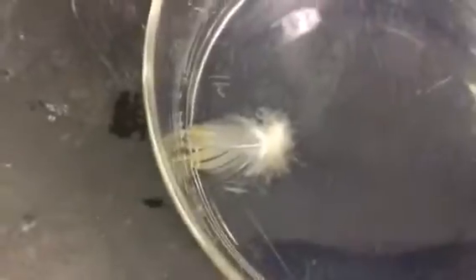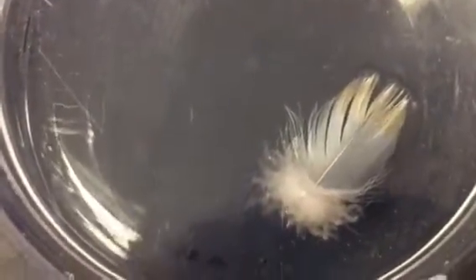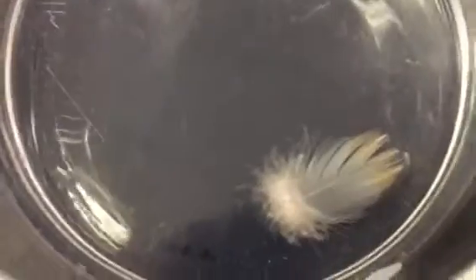And go back again here, essentially, and I'll just cause this now to push this over. You can see where the water is actually encroached on the feathers, and the fibres are driven together like the fibres of a paintbrush. Now I'm going to lift this out now to demonstrate. If I lift this out now, you see the capillary action has driven the feathers.